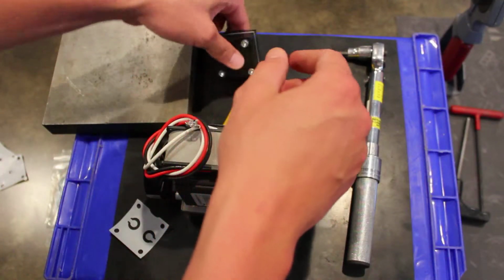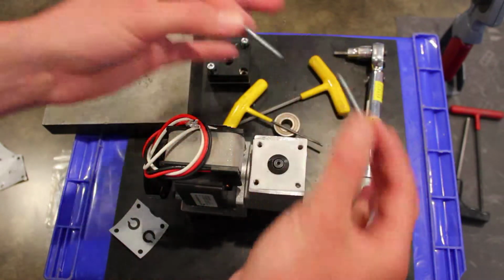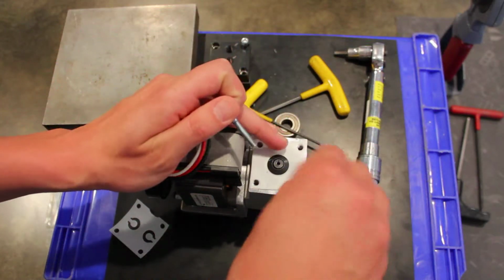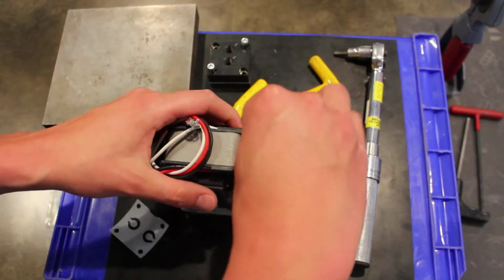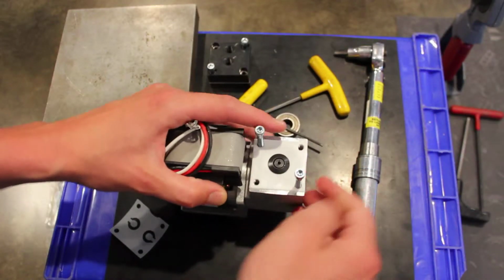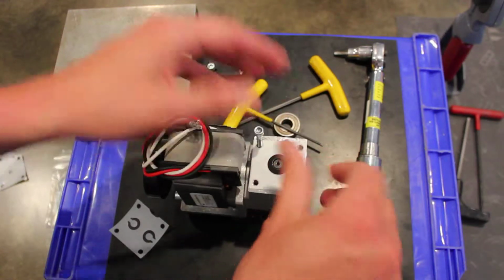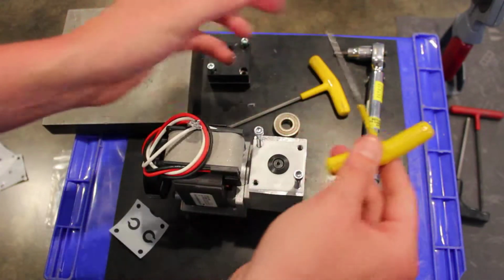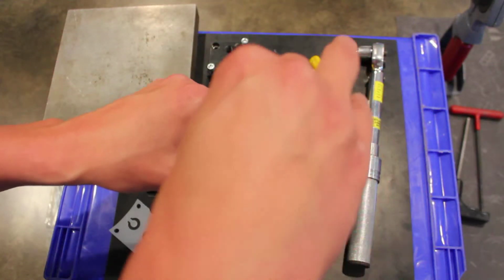And now what I'm going to do is, back to my head assembly, I'm going to borrow 2 head bolts. I'm going to install one diagonally here and one diagonally here. And just make sure my diaphragm's clean of any sort of contaminants or debris. Got those on a few turns. And then I'm going to grab my 3/32 Allen wrench and start to tighten down the diaphragm screw.